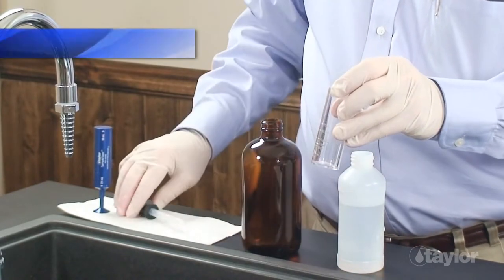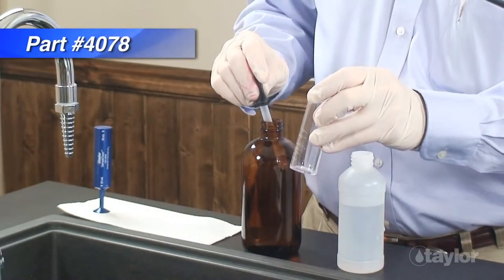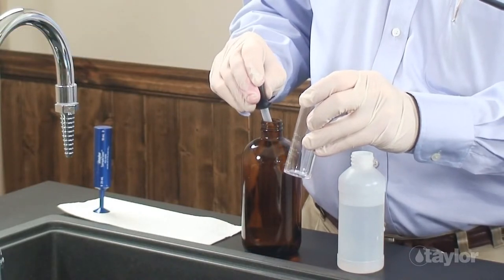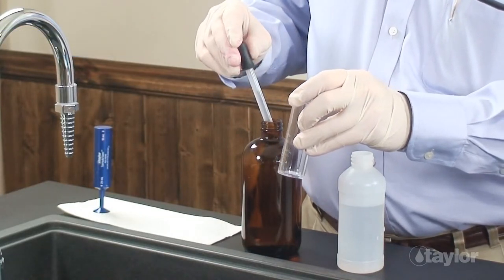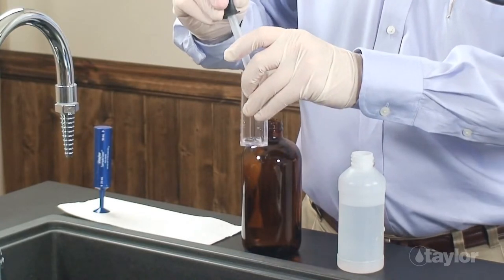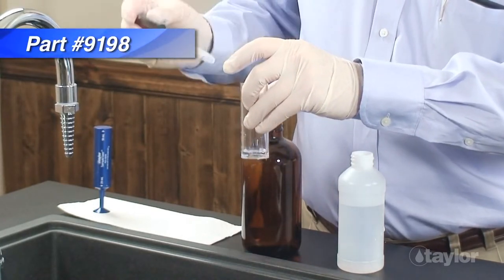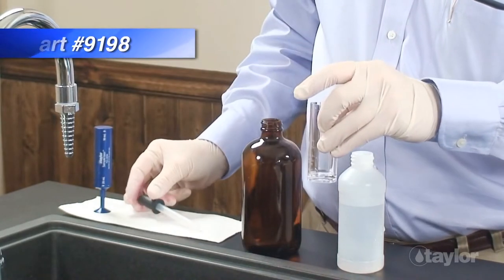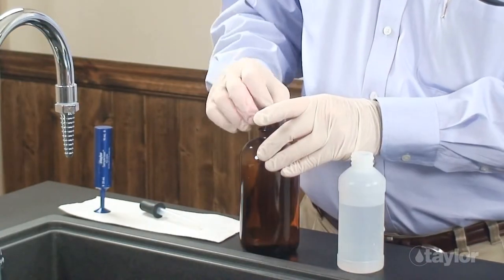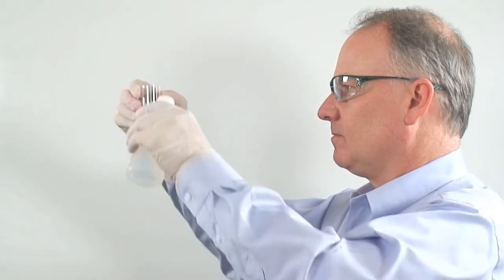Fill the 3-milliliter pipette to the 2.5-milliliter mark with the water to be tested. If the sample is turbid, it must be filtered before proceeding with the test. Place this water in the second 25-milliliter sample tube and dilute to the 25-milliliter mark with distilled, deionized, or molybdenum-free tap water.